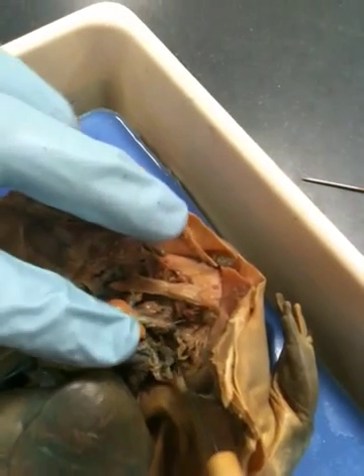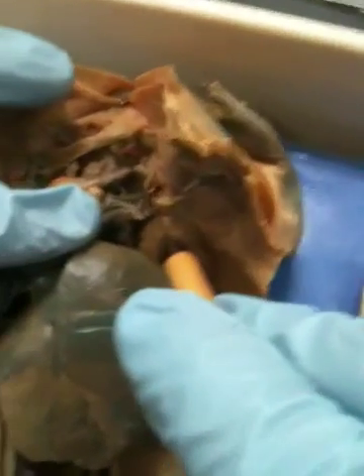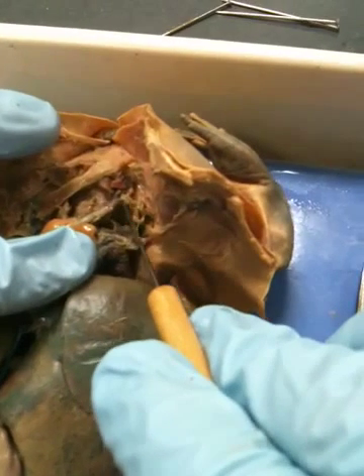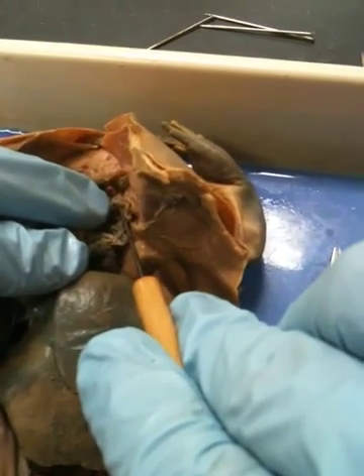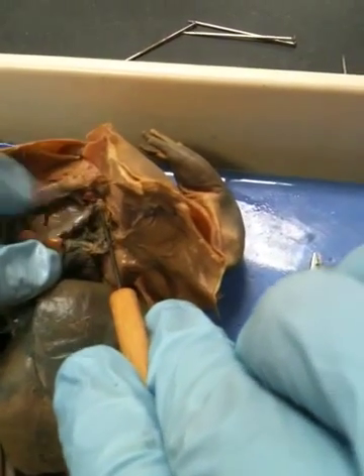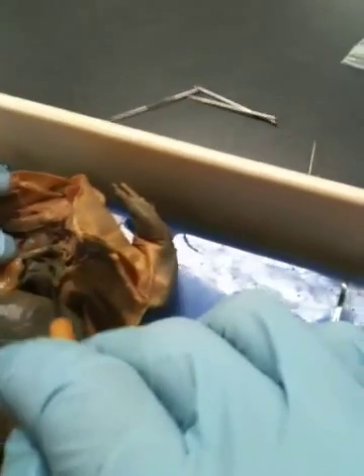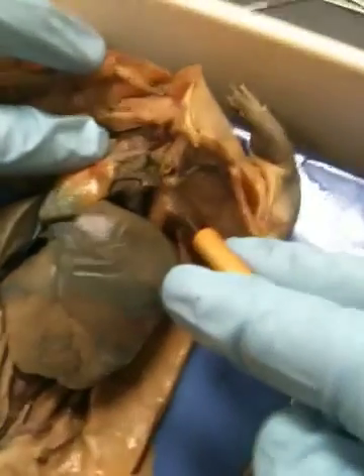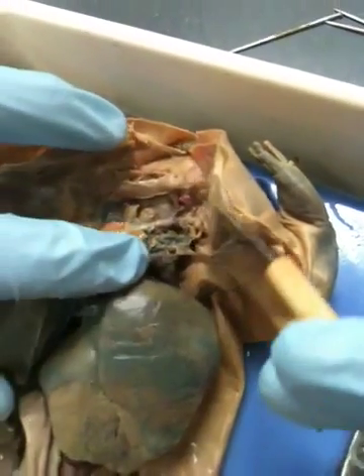The top one is the carotid artery. The carotid artery can be told by the carotid body, which does a lot of different functions in the body, but right here it's a little bit rounder than the rest of the artery, so that's different. Then we also have one of the arches that runs to the lungs. This is the pulmocutaneous. The pulmocutaneous also splits off somewhere and goes to the skin.